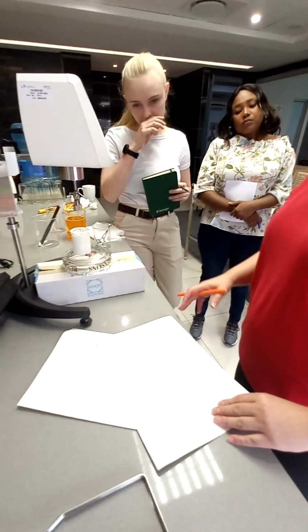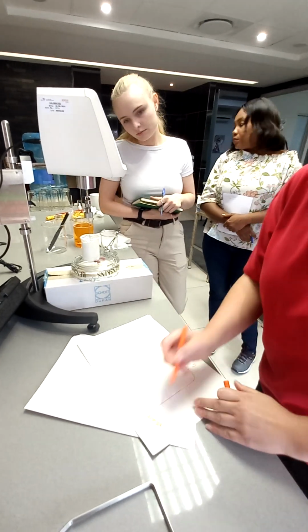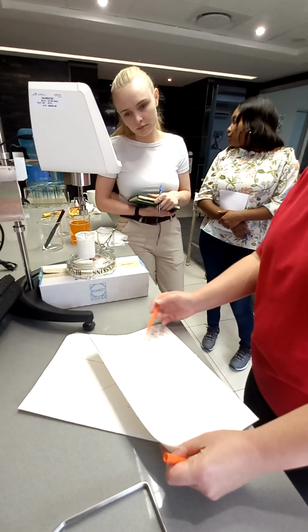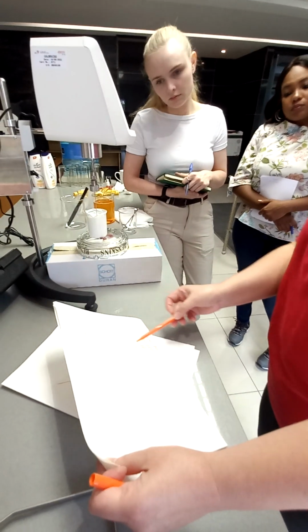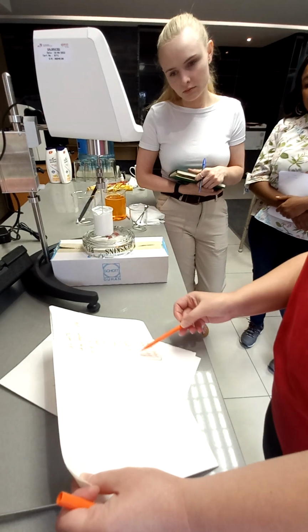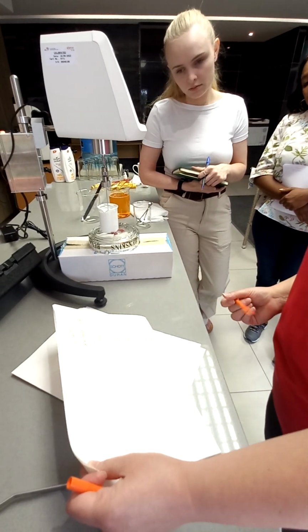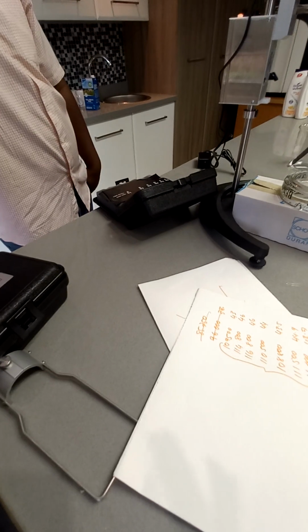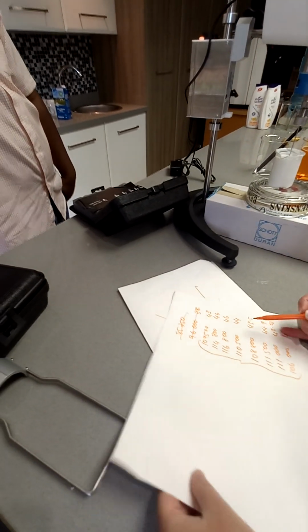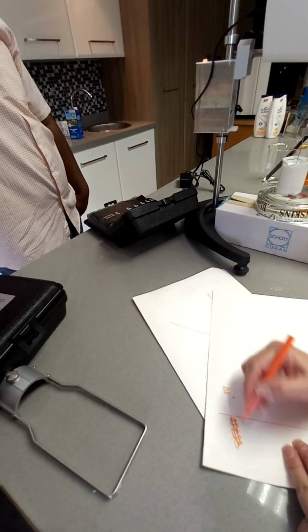So now what I want to do is, let's take this one away. Let's take an average. Looks about 110,500. Remember, non-flowing products have a big acceptable range. 110,500. Okay.